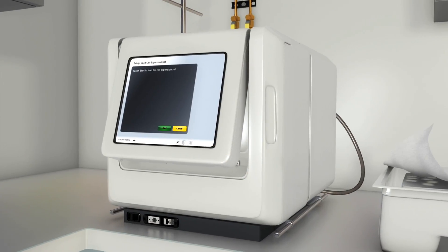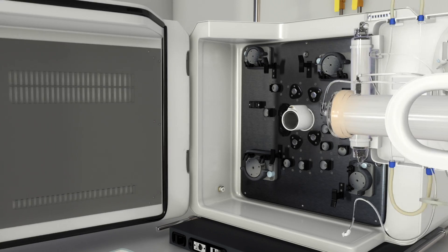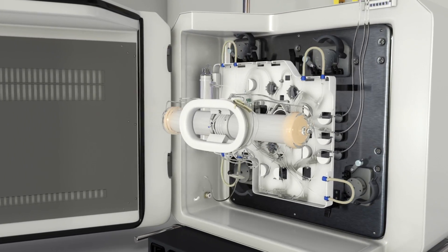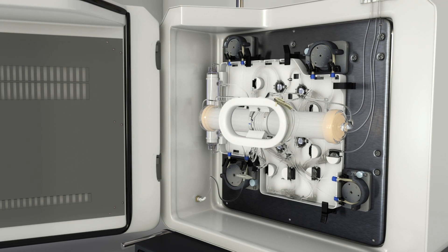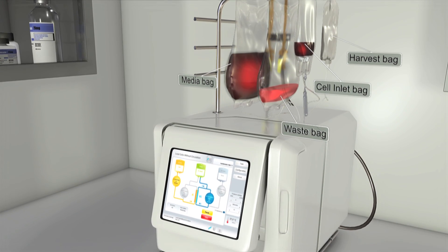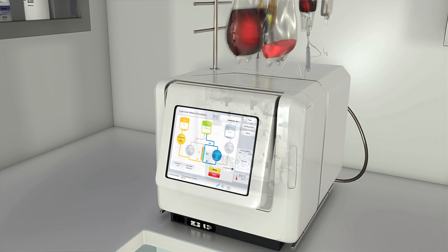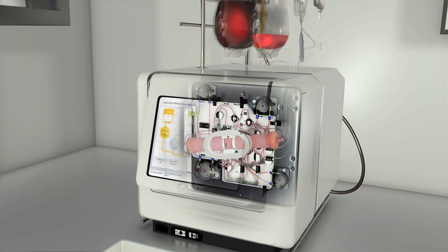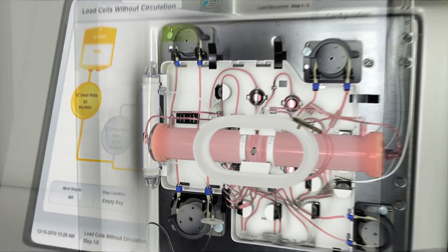At the core of this functionally closed and fully integrated system is the disposable cell expansion set, which is easily loaded onto the Quantum System. Media is introduced in preparation for cell loading. The cell inlet bag is attached to the cell expansion set using a sterile welder. Cell populations travel into the bioreactor, which is spanned by thousands of semi-permeable hollow fibres.